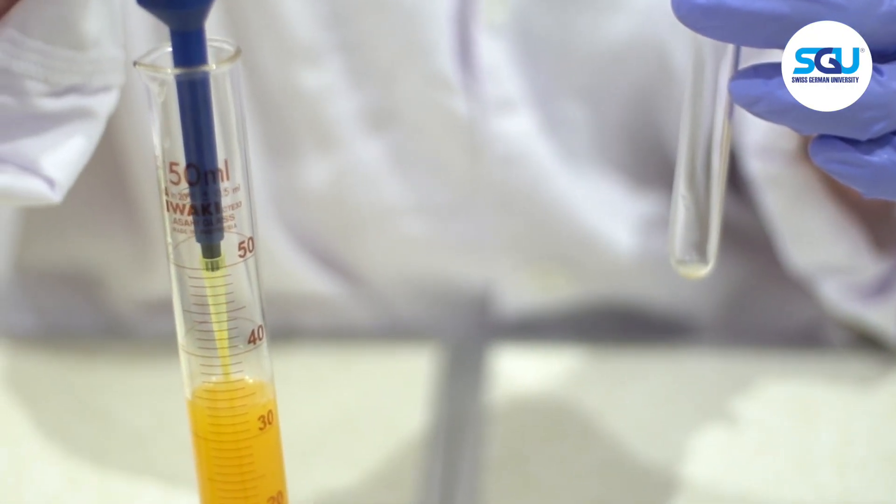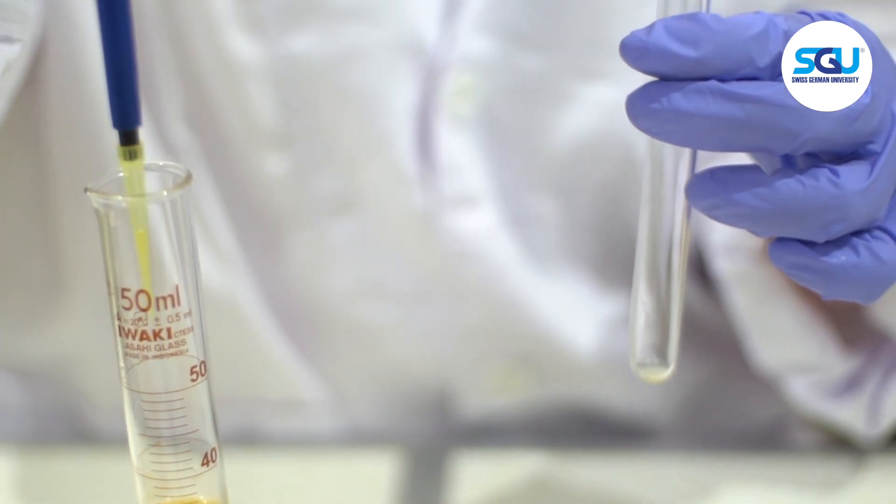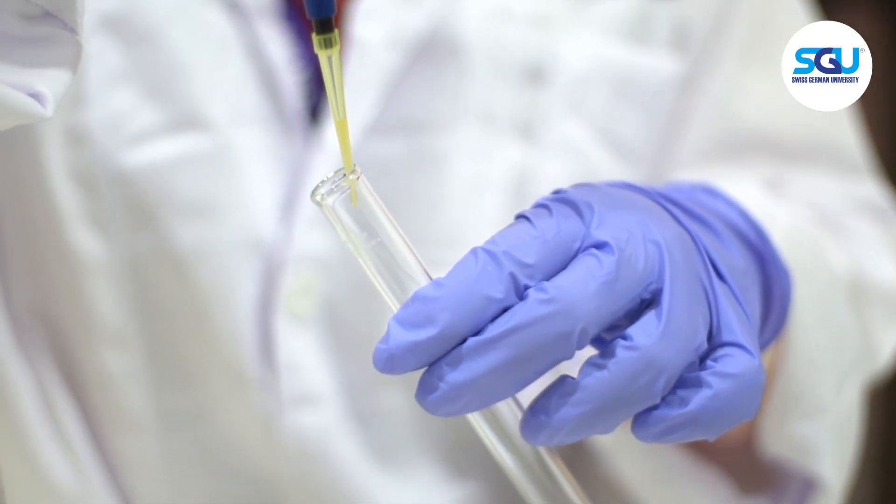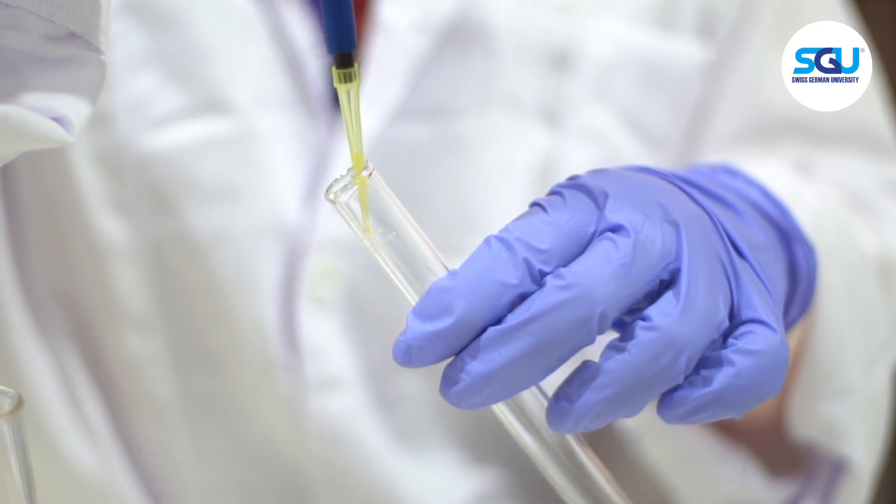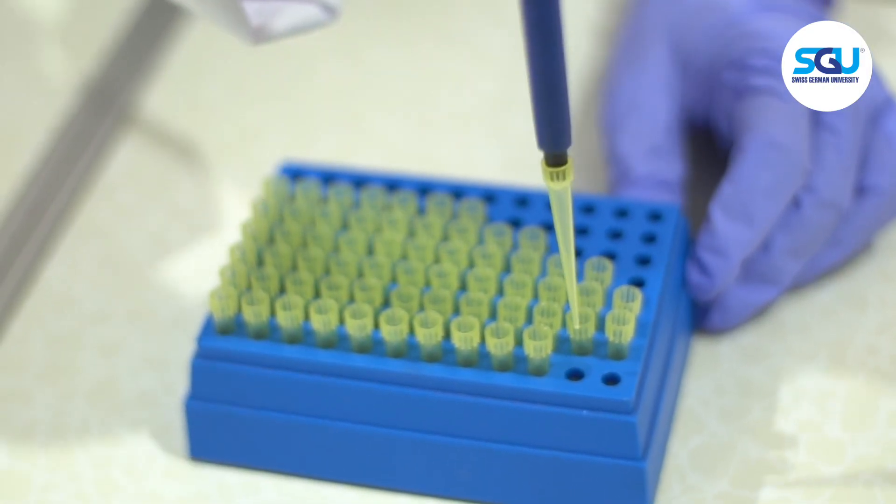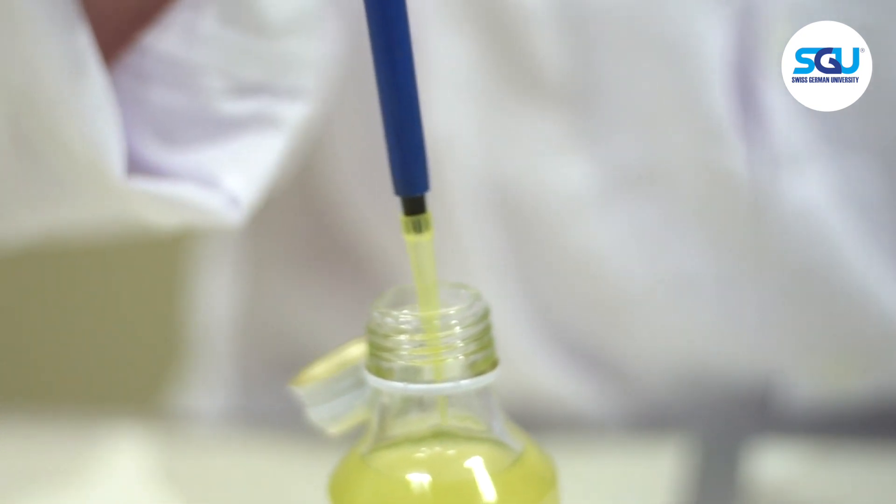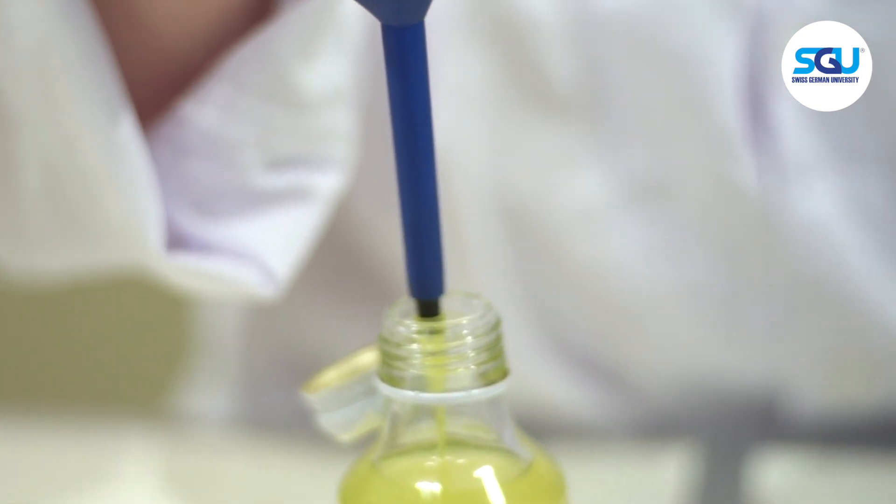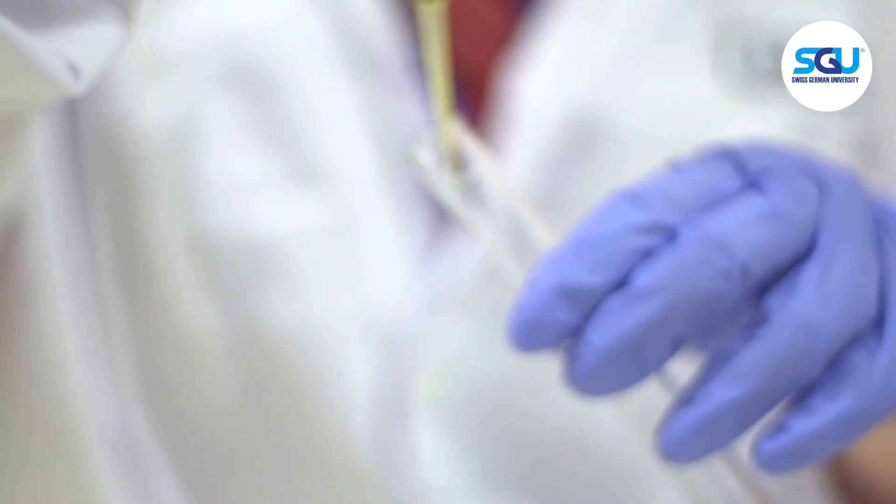The sample of orange juice was taken and transferred into a test tube. The same amount of volume was also taken from the commercial vitamin C drink into a different test tube.